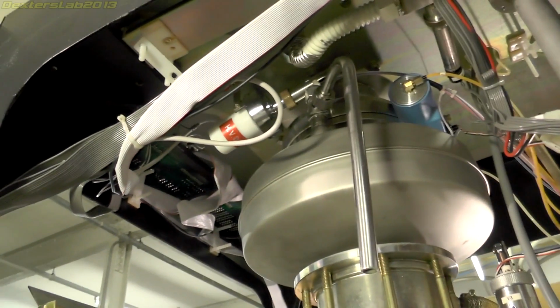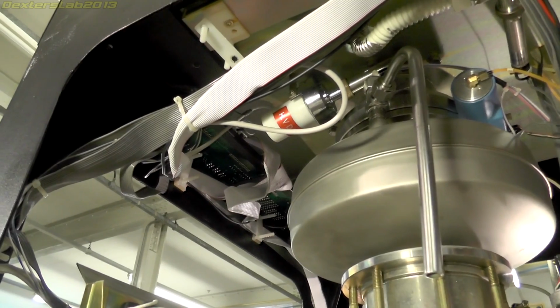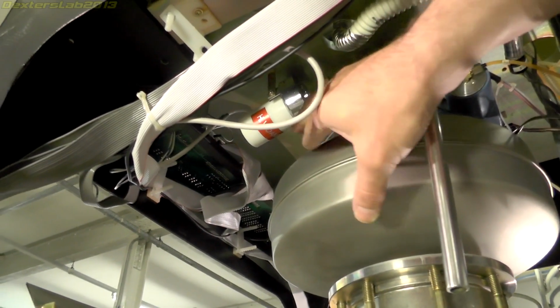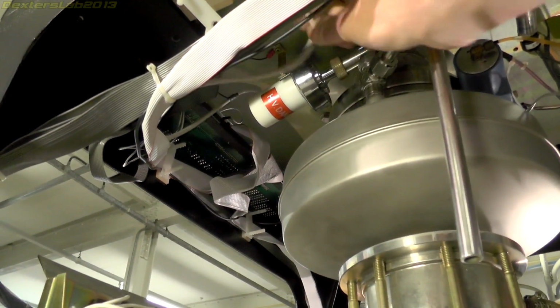The underneath there. I think that white thing with the high voltage written on it, just up there, I believe that is the penning gauge.